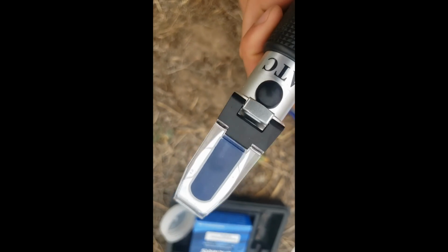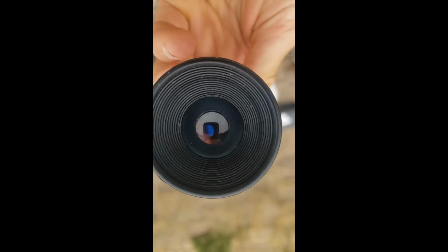Sample on, close this disc, and look through the hole, up into the light. And you can see this is for the pond. It's also pretty clear. How would this change if we had gotten some of the duckweed in there? Or if this was a dirty, murky water?